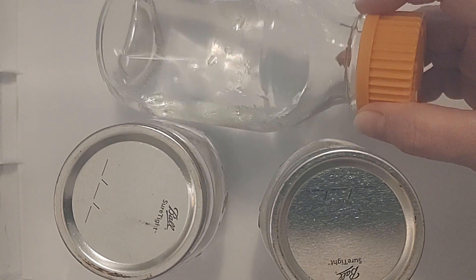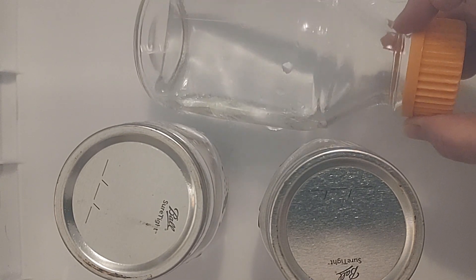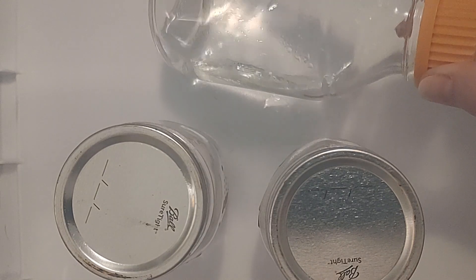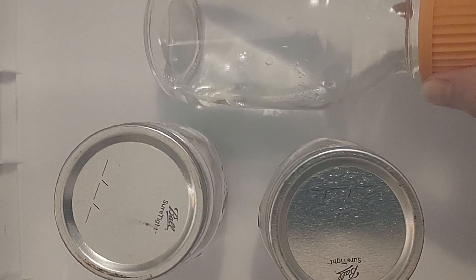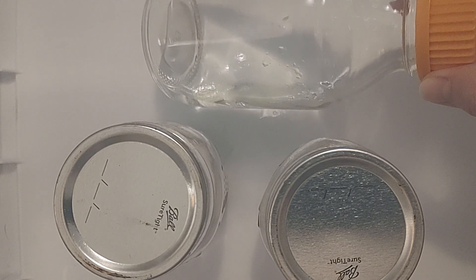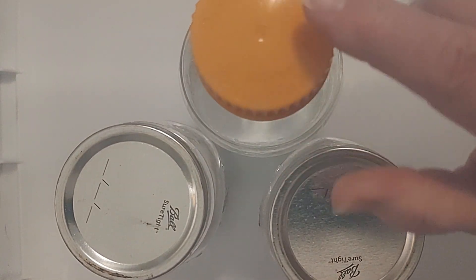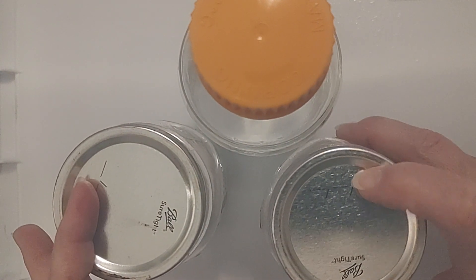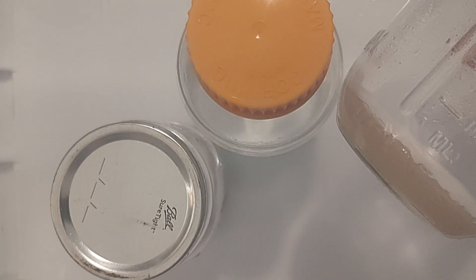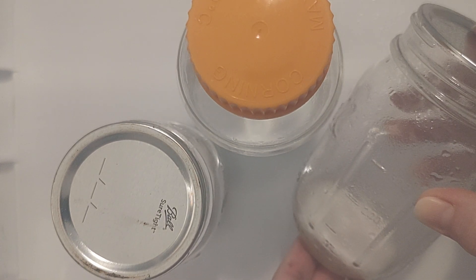There's so much alcohol in the Still Air Box right now. What we have here is purified water that's been pressure cooked — my husband pressure cooked this. It's 200 milliliters of water, pressure cooked for 40 minutes. So it is sterile water here in this container. And then here I have two agar plates, agar dishes in these very large jars.